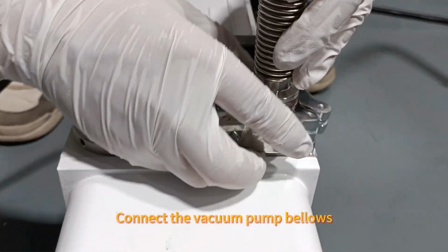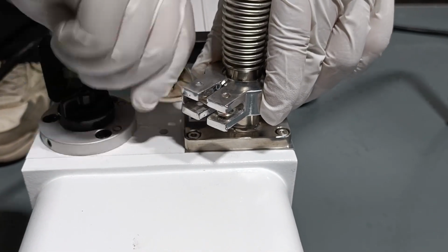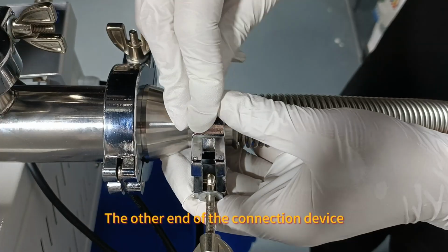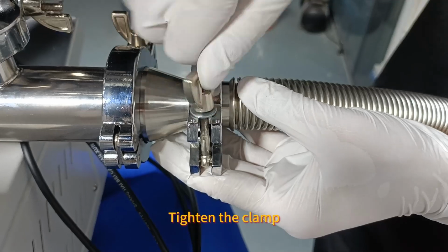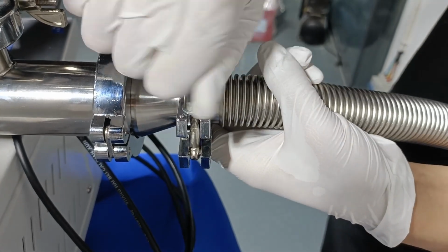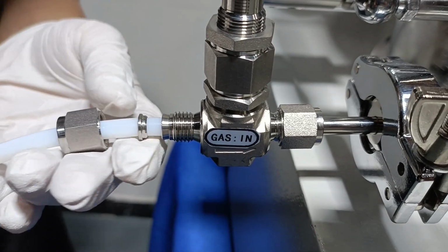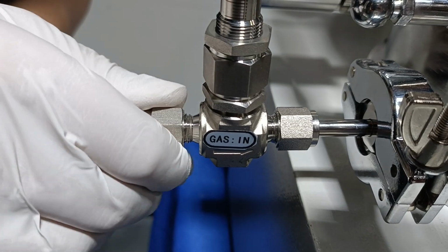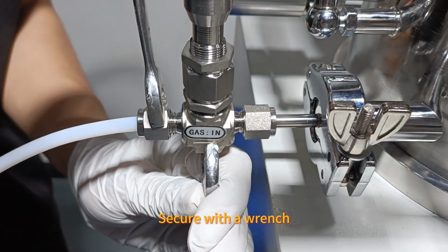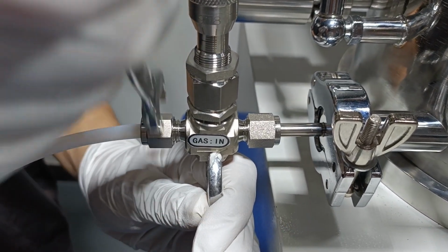Connect the vacuum pump bellows. Tighten the clamp. The other end of the connection device. Tighten the clamp. Gas connection. Tighten the screws. Secure with a wrench. Another wrench to tighten.